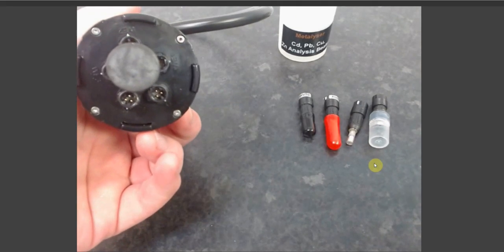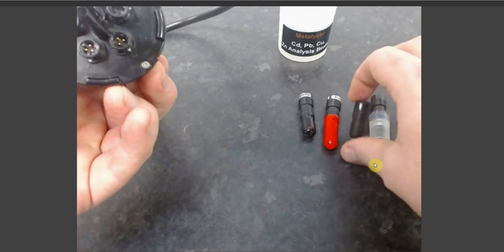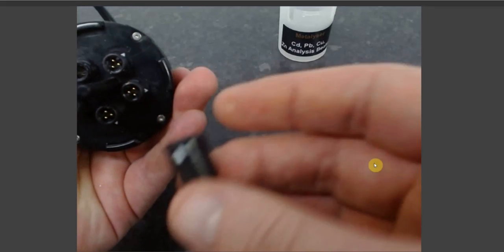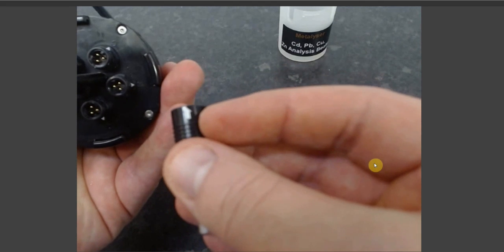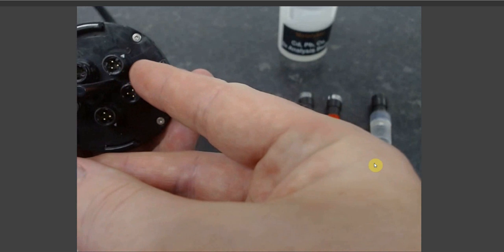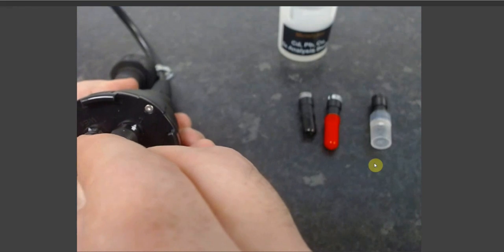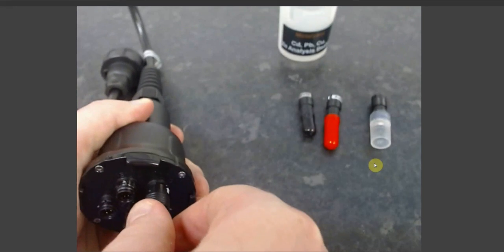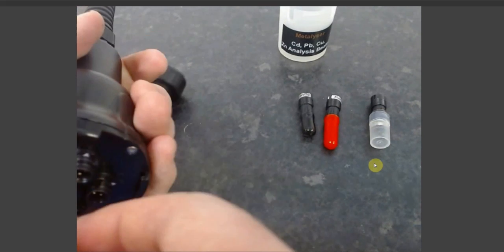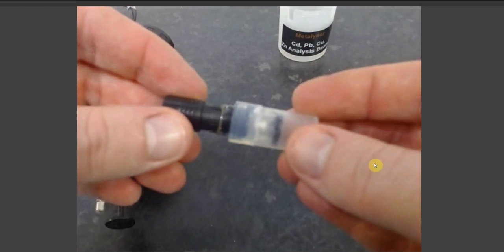The first step to setting up your HM3000 sonde is to take your counter electrode, find your counter electrode slot, find the white arrow on the slip of the counter electrode, match it to the white arrow on the sonde so that the two line up, like so, and push the electrode home. Once that's nice and snugly fit, you can then move on to your reference electrode.